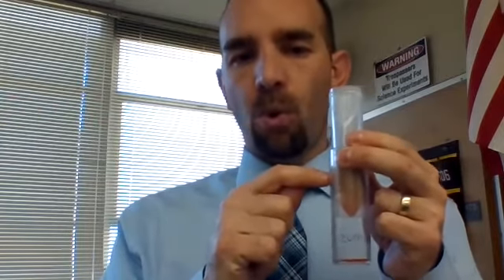Then we look at what the color was. The darker the color, that means less attraction, and the less water we have to put through the sample also means less attraction. So if I have to put five milliliters of water to get a drip of that orange color versus 20 milliliters, the 20 milliliters tells you that the eosin Y or the crystal violet was more attracted to the soil. If there's no attraction, the color would run through quicker. The more water we have to use tells you that there's a greater attraction.